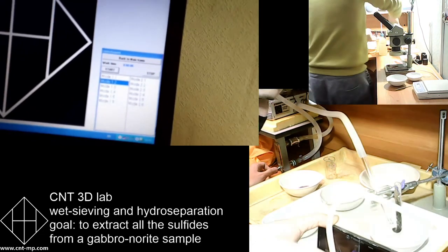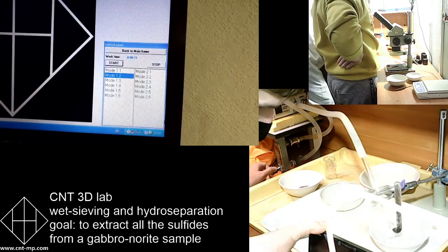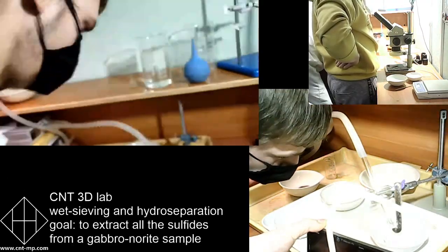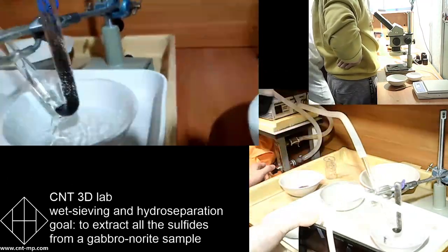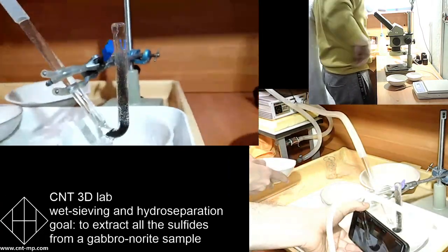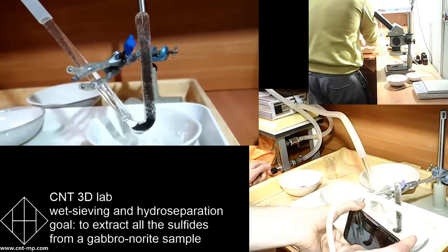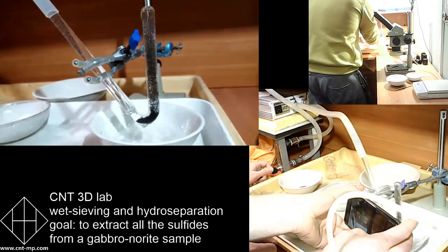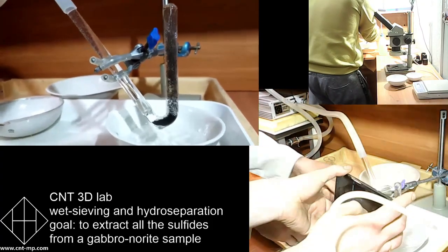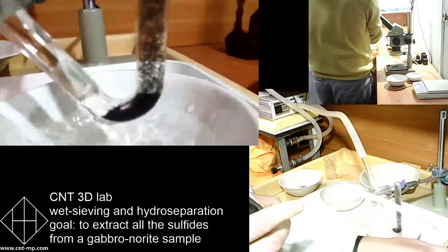There are two types of tubes. One is long and one is short. There is a computer with a special control panel there. There are different control panels, but this one is for using hydroseparation in a semi-automated mode, whenever you have an experienced user who can do it on his own knowledge, knowing how to use the hydroseparation device, which regime to use, and so on.